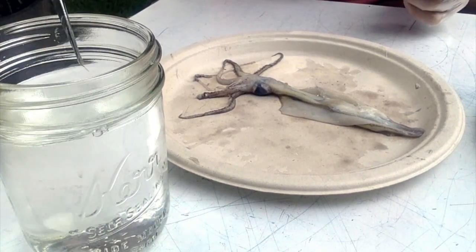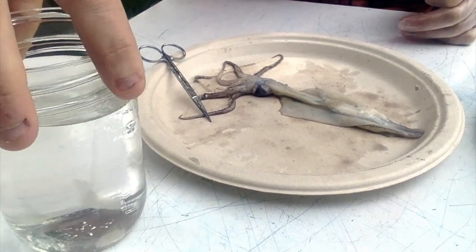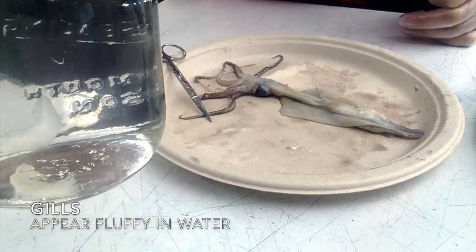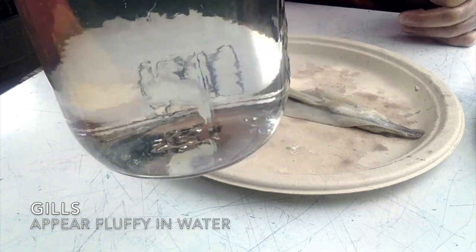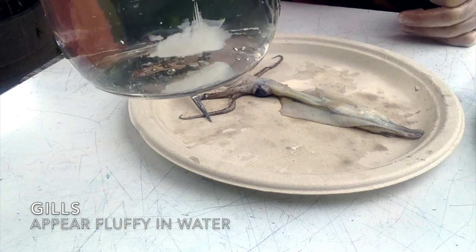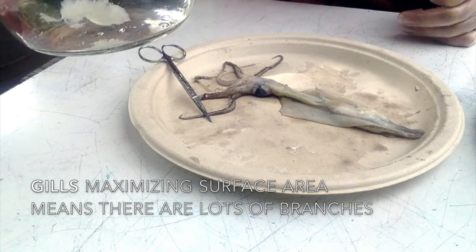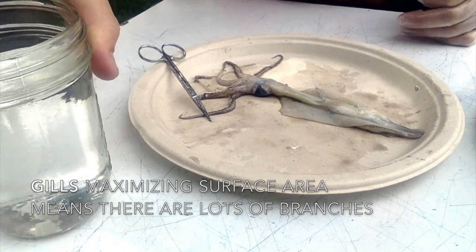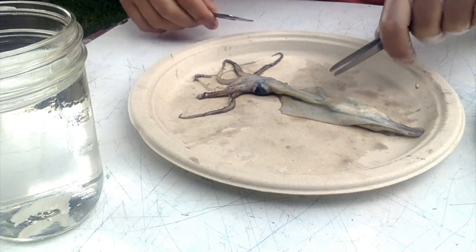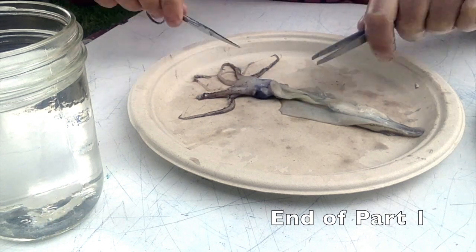I tried to use a little bit of warm water to help expedite this process, because we all know that if the molecules are a little bit warmer, they'll move a little bit faster. So you can see how that fluffs up nicely. Hopefully you can see. And that's how you know it's the gills, because they have to maximize their surface area to extract oxygen out of the water so that the squid can breathe. That's what gills do. Kind of similar to our lungs, but they extract oxygen out of the air and transport it throughout our body and our blood. And so these guys have blood too, but it is clear, so it's very hard to see.